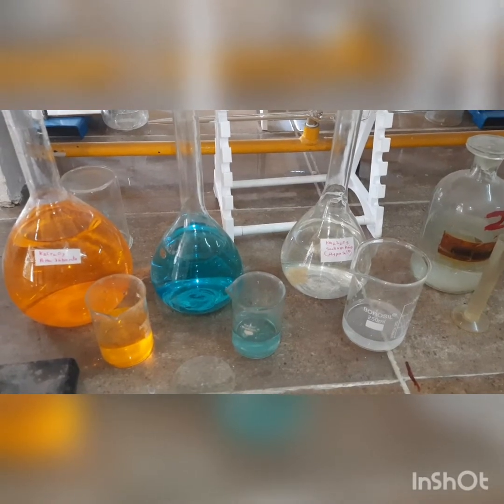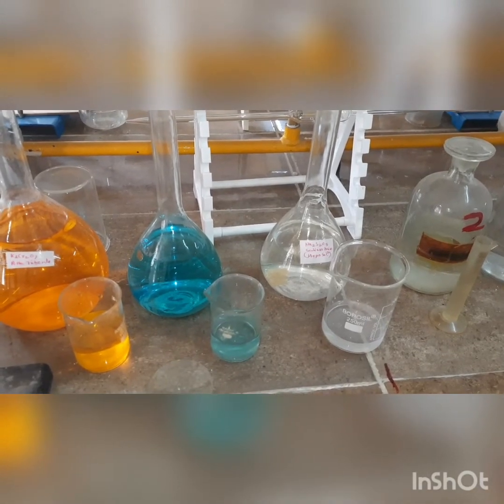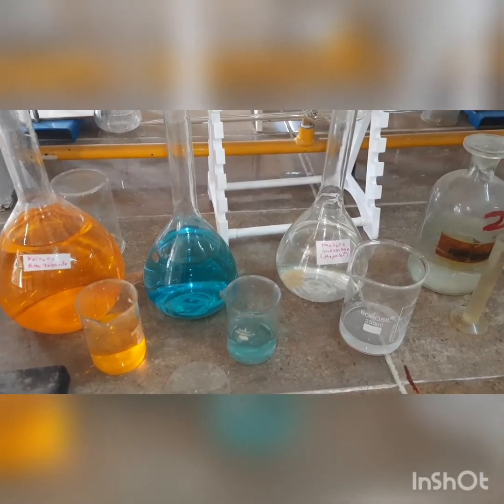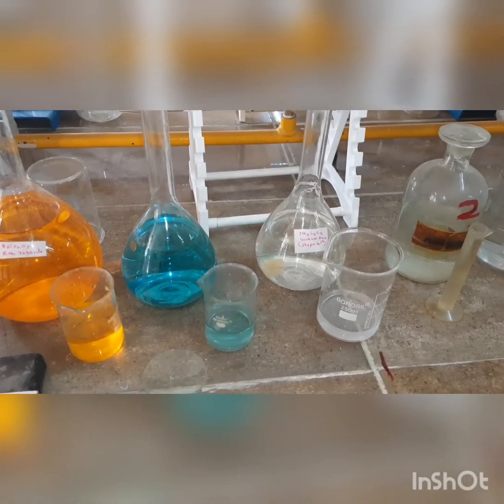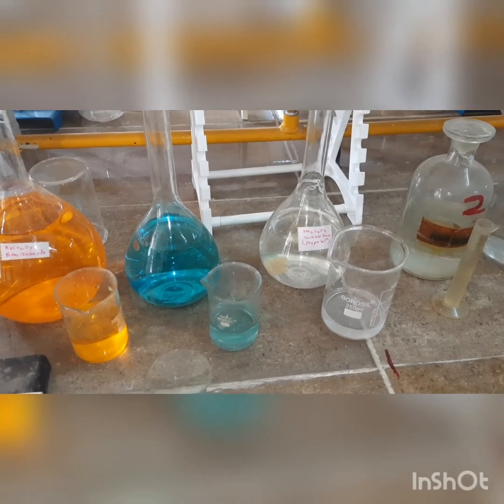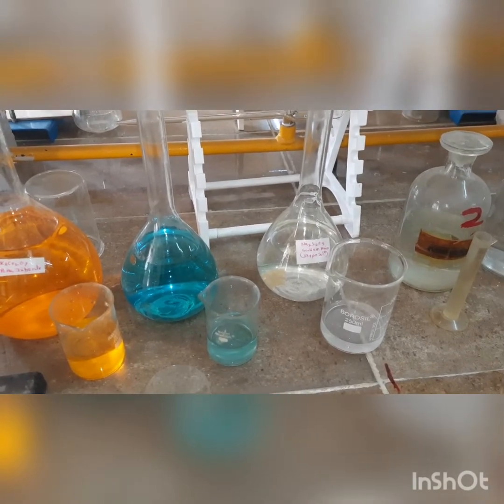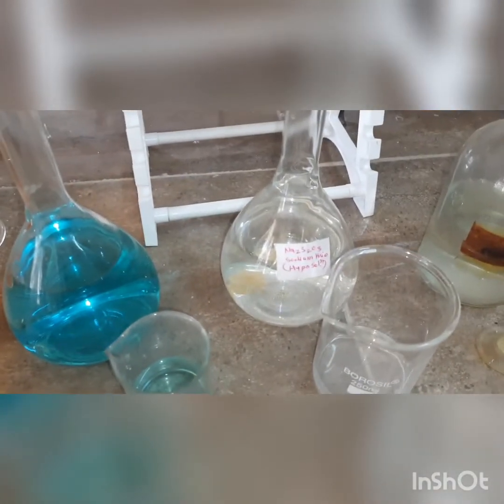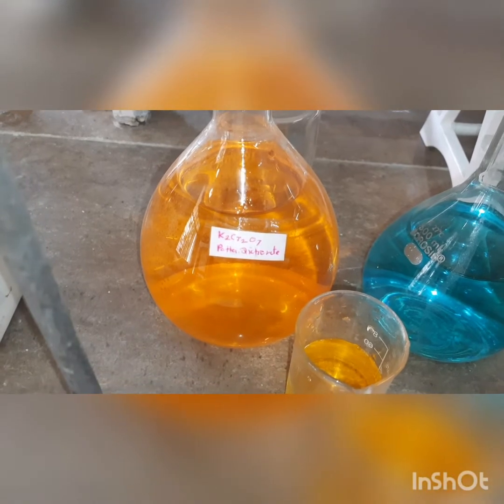The second category is iodometric titration, which we are going to perform today. Iodometric titrations are defined as those iodine titrations in which some oxidizing agent liberates iodine, and then the liberated iodine is titrated against a standard solution of reducing agent placed in the burette. In the burette today, we are going to take the hypo solution — this becomes our reducing agent. We are going to standardize this hypo solution against standard potassium dichromate solution first.